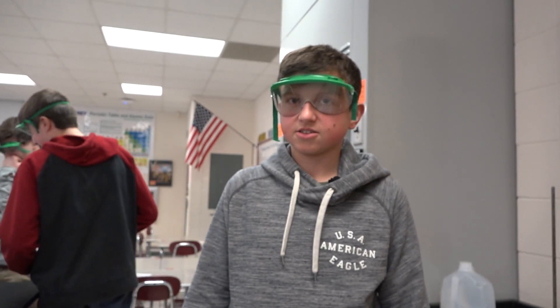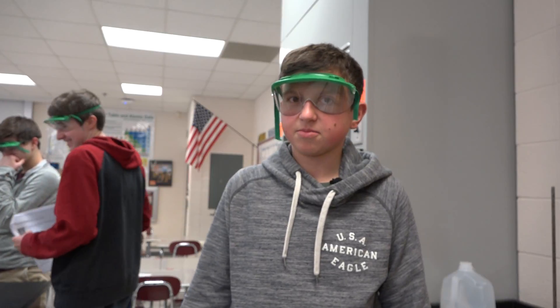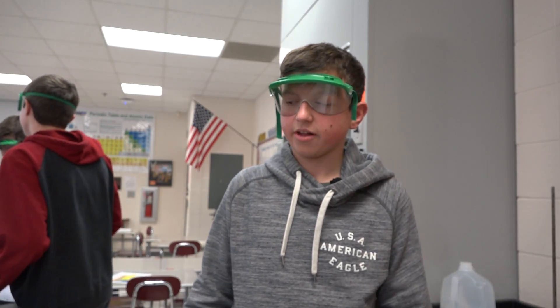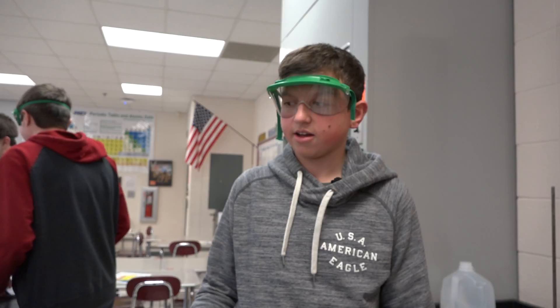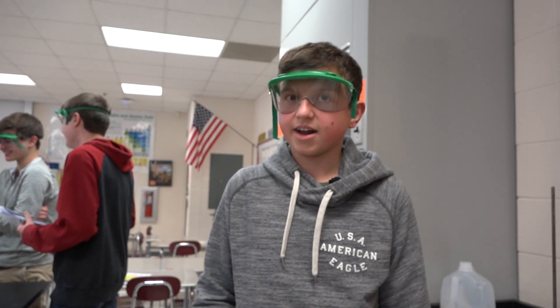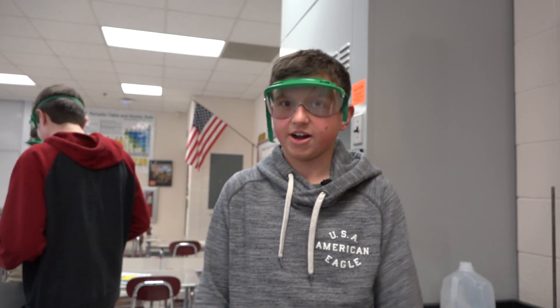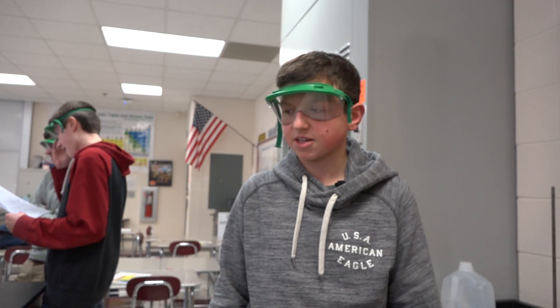We're trying to figure out what substances were found in a girl's backpack based on doing tests to identify the substances. We are comparing them to tests we are doing with substances that we know, and if they match up, then we've figured out what the substances were that were in the backpack.